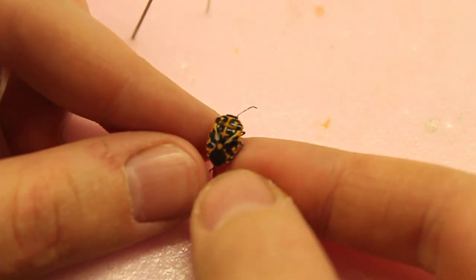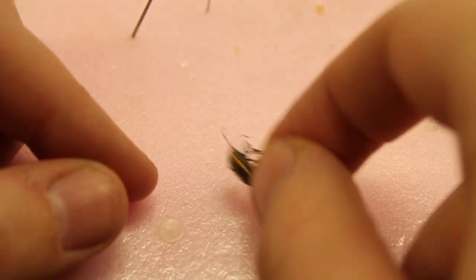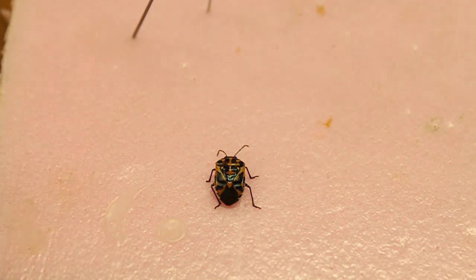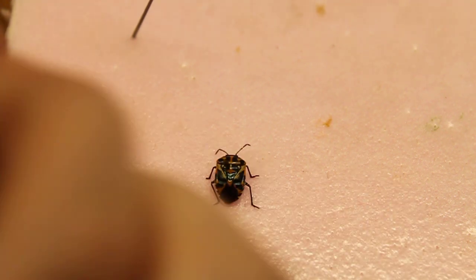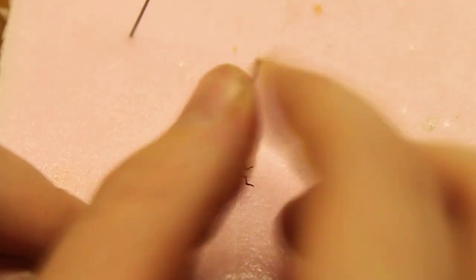This is what this one looks like — it's a true bug. It does have a second antenna, it was just hiding. The rule of thumb with true bugs is they have a little kind of triangle right here in this area, and that would normally be where you want to pin it — right there.